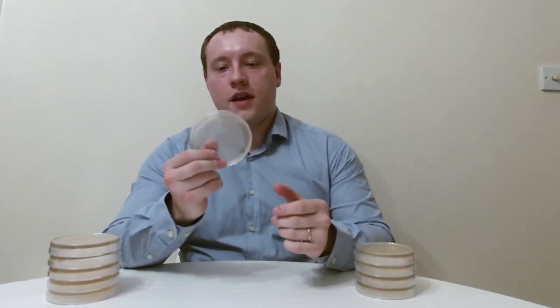Hello, this is Dr. Chobsey and welcome back to another video. Today I'm going to show you how you can make one of the most important tools that a microbiologist uses in their day-to-day life in the lab — an agar plate.